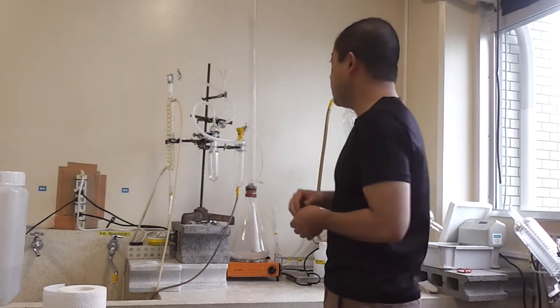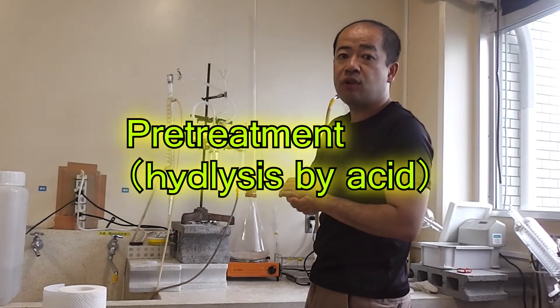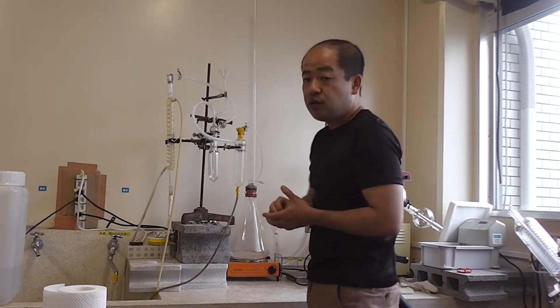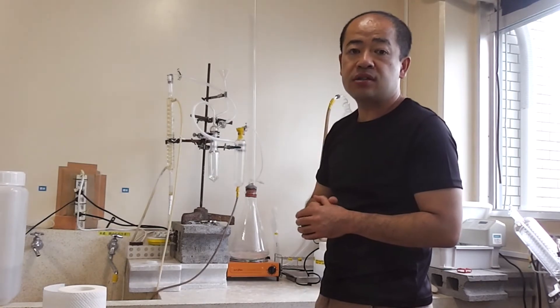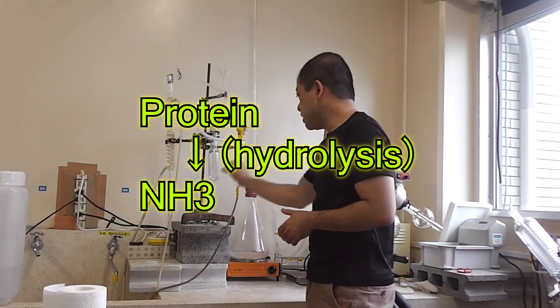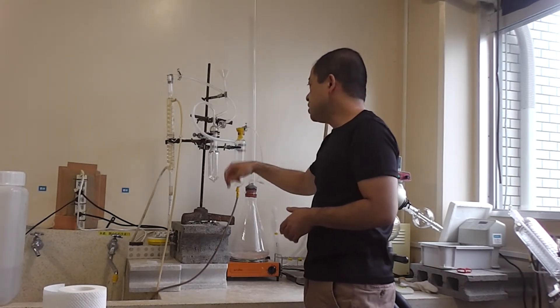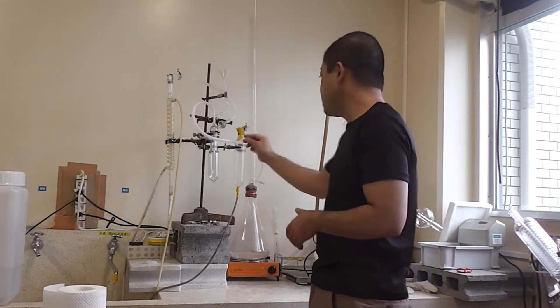So for analyzing protein, we try to put the samples. Samples should be previously hydrolyzed by adding acid and putting inside here. By hydrolyzing, the protein should be converted to the form of inorganic nitrogen — so it means ammonia nitrogen. So if you put the samples as a form of ammonia, and we try to put the alkaline sodium here, and we try to put the steam.